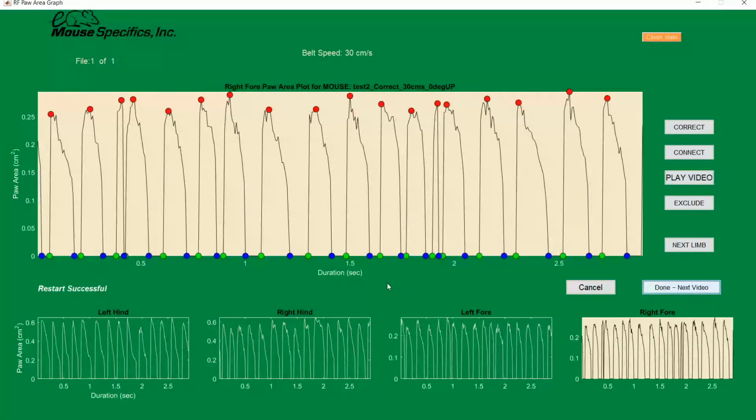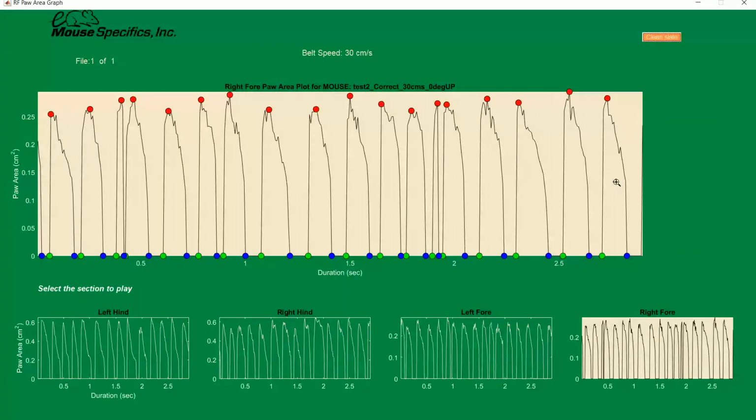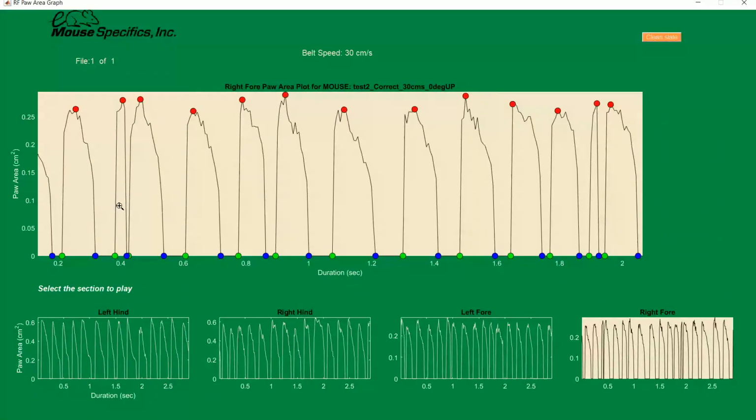Here's another example of using the correct editing technique on some gait signals. In this set of data, there are 2 areas of noise that we'll want to look at that look different from the rest of the signals. These noisy parts are a bit less obvious than what we saw in the last example and emphasize why it's important to use the play video button on anything that looks a bit abnormal. Let's begin by using the play video button to take a look at what happens in each. Click the play video button, click once to zoom in and once to the left and right of the area we want to look at.